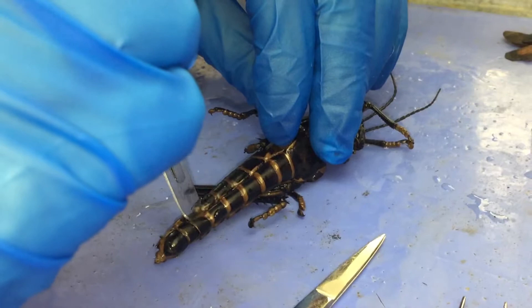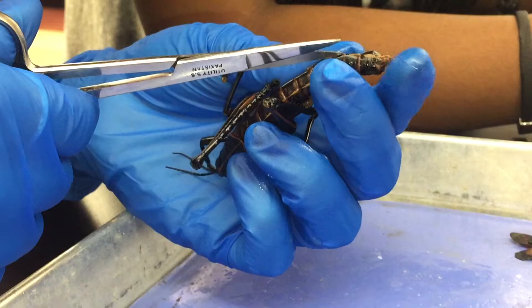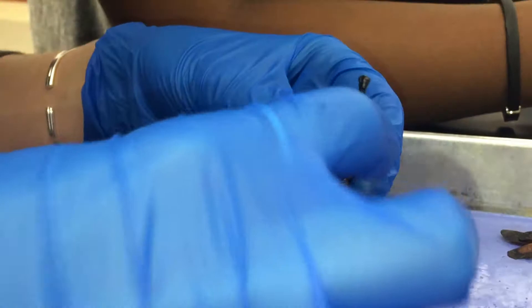We can get multiple angles, this is gonna be good. No, it's leaning over — that's wrong. Get back in there. I'm not worried about the bug, I'm worried about the scissors — they look much closer in the camera. I've got the two cuts down the side.